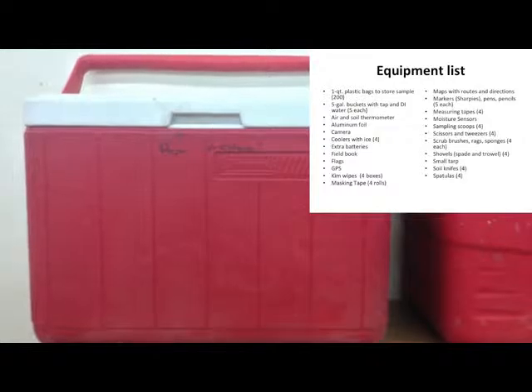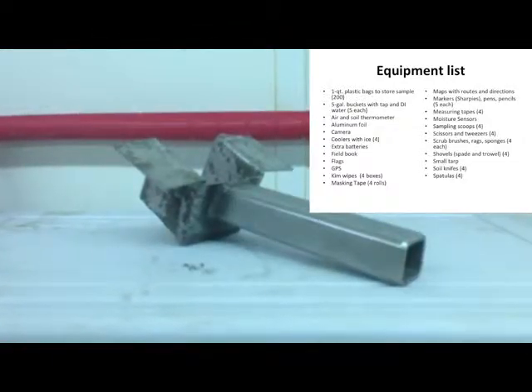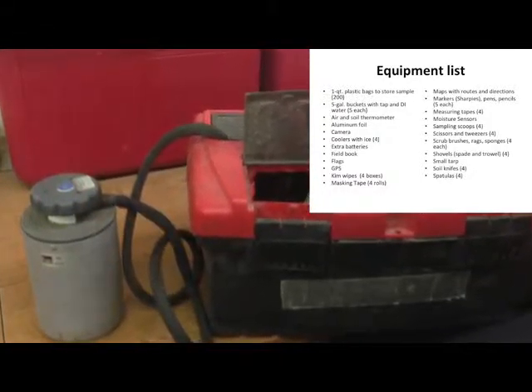It is important to collect all of your sampling supplies a few days before you plan to sample. Equipment needed for sampling is outlined here. This list can also be found in your sampling protocol.